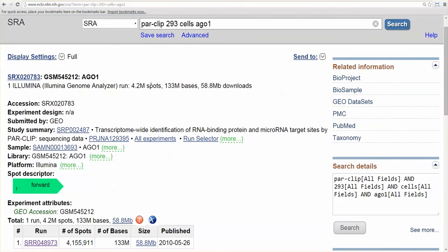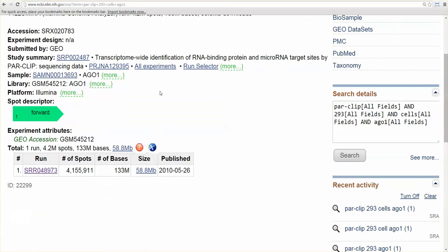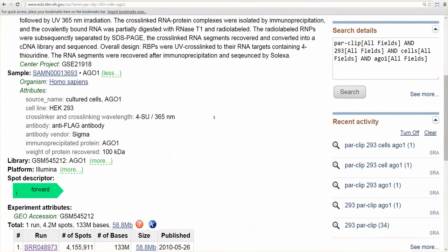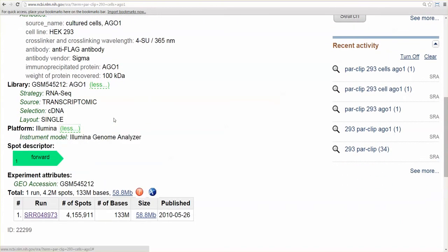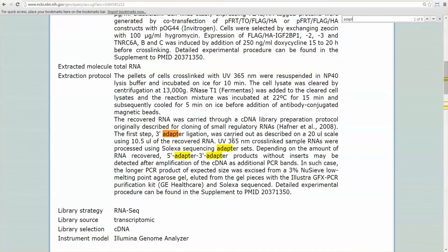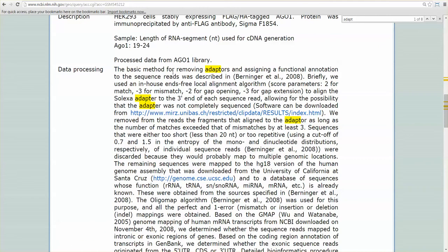So once you find a data set you're interested in, you'll get a bunch of information, but no matter where you go, you won't be able to find the 3' adapter sequence. At least most of the time, you won't be able to find it. There's even a GEO accession you can go to, and that page will have more information, and you can search for the 3' adapter, and they tell you they did in fact use a 3' adapter, and in fact they'll tell you that they removed it when they analyzed their data, but they won't tell you what the sequence is. So these journals require scientists to make their data publicly available, but the scientists don't always give you all the information you need to analyze the data.